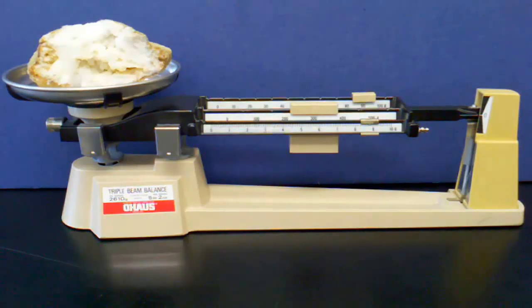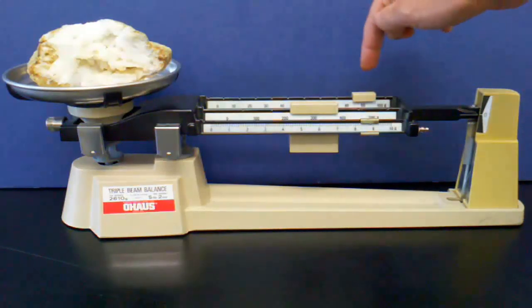Next, I total up the mass of the different slides. Starting with the 100's place in the center, I have 398.8 grams.